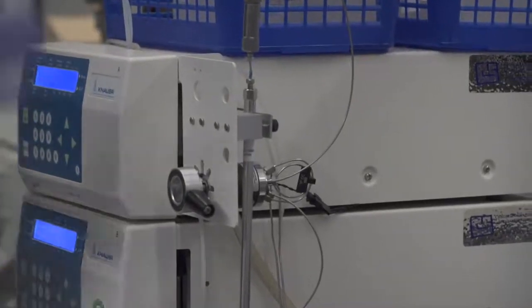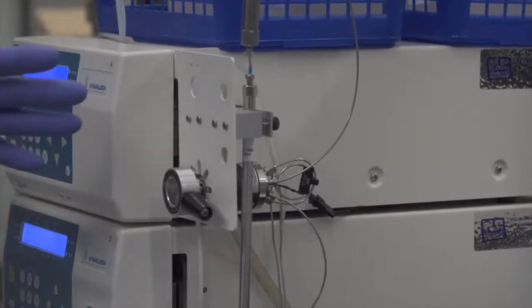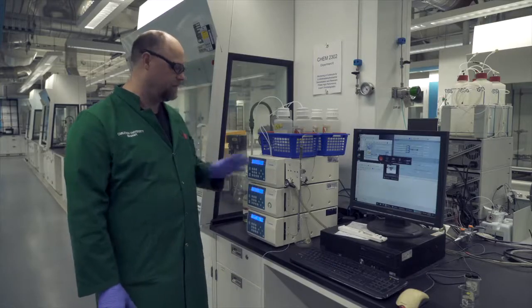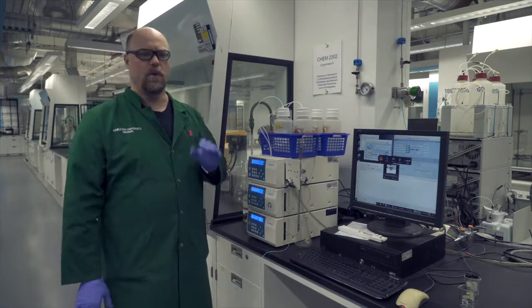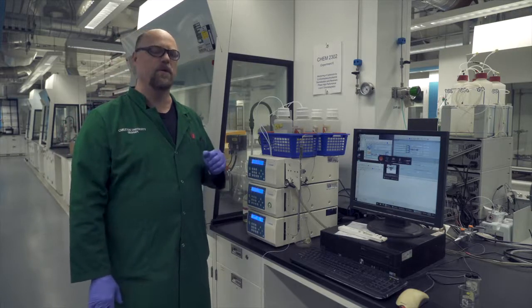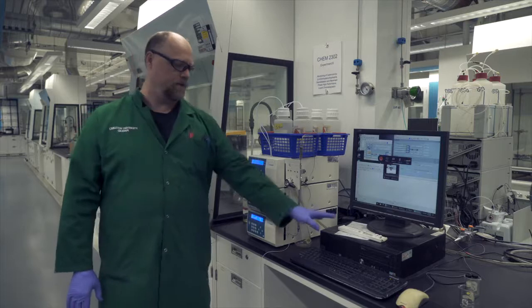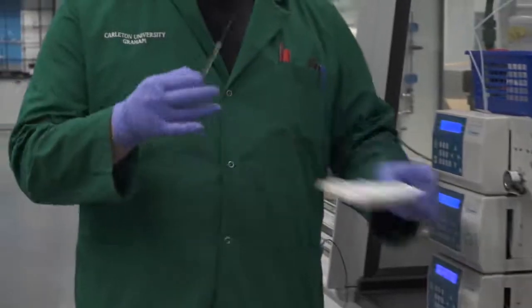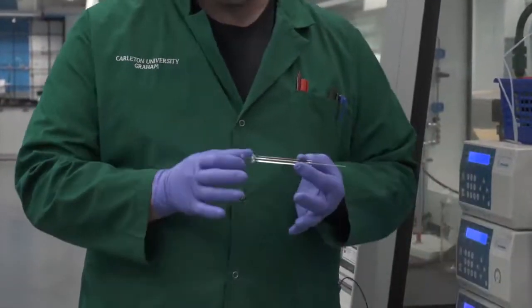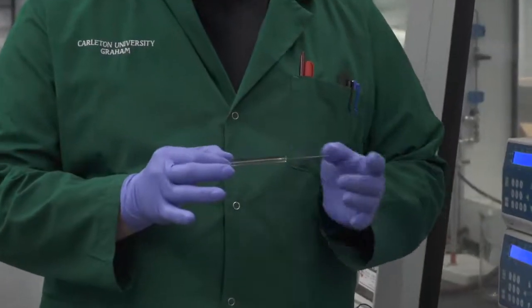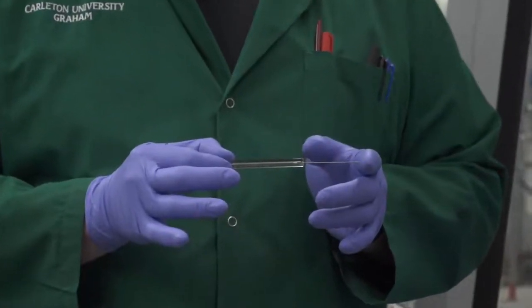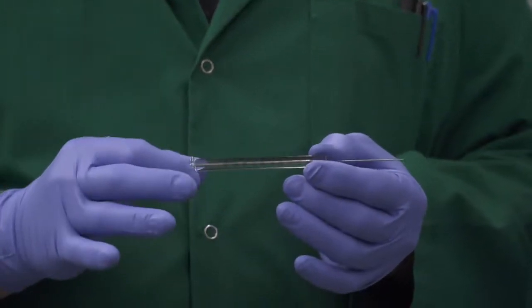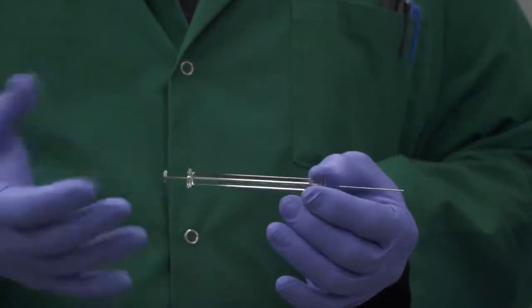The last part that we'll talk about in a little bit is the computer which we'll look at in a few minutes. So the first thing you're going to want to do when you come to this instrument to use it for an analysis is you're going to want to get the syringe. This is the one that you'll be using. It's a very special syringe in that it doesn't have a point on this end of it. It's a flat point, so it'll differ from a GC syringe.